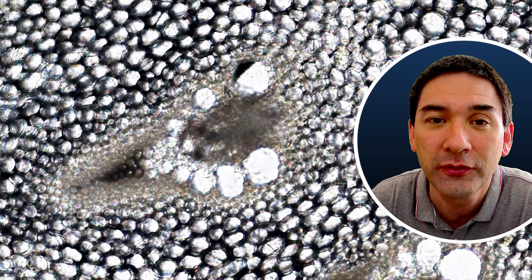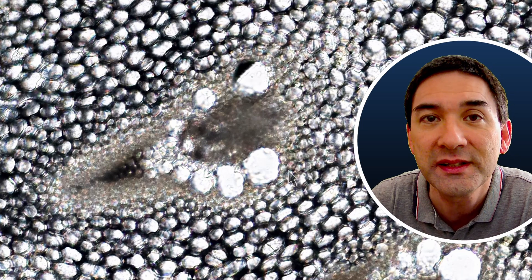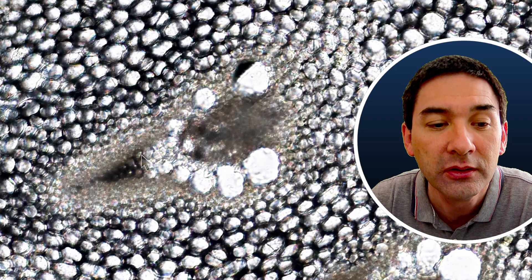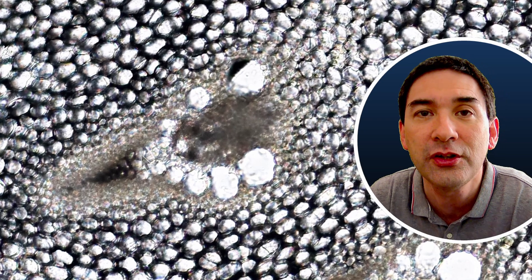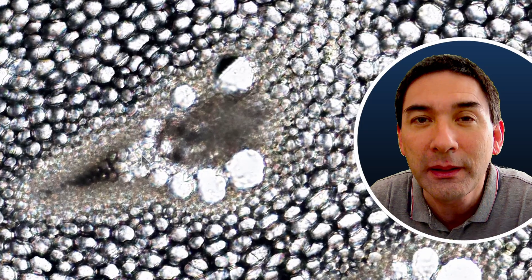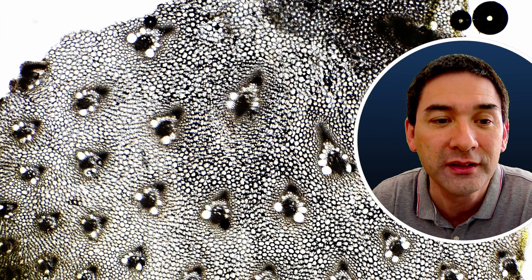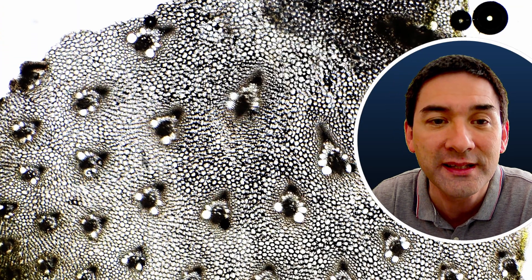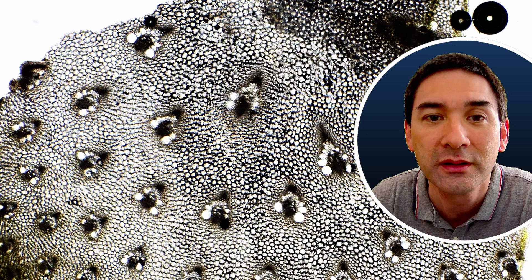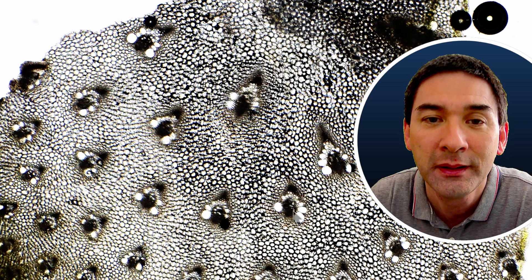We have the xylem and phloem, and the whole thing together is referred to as the vascular bundle. Simply by looking at how these vascular bundles are arranged in the stem, this tells us quite a bit about whether it's a dicot or a monocot. Here we can see quite nicely that the vascular bundles are scattered throughout the stem - it's a typical monocot arrangement.